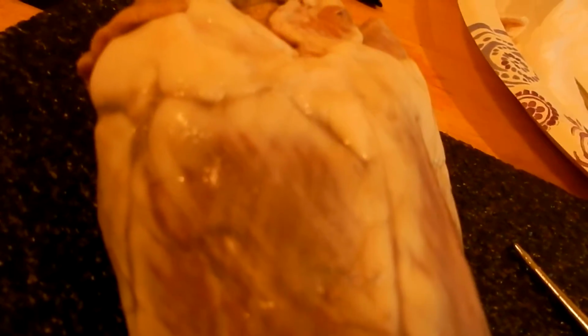When we're talking about the heart, some housekeeping things. We have the vena cava, which is the large vein that brings the deoxygenated blood back to the heart and empties it into the right atrium. So that's why you have the deoxygenated blood in the right atrium. There are two atria, as we saw, the right and the left atrium, which are two upper chambers of the four muscular chambers of the heart.